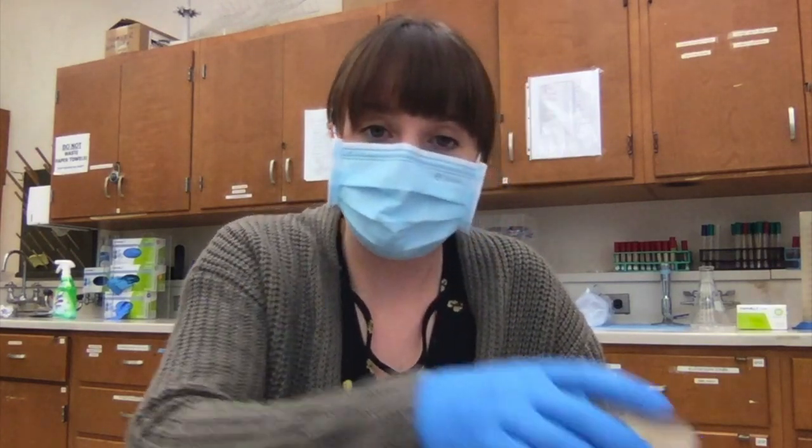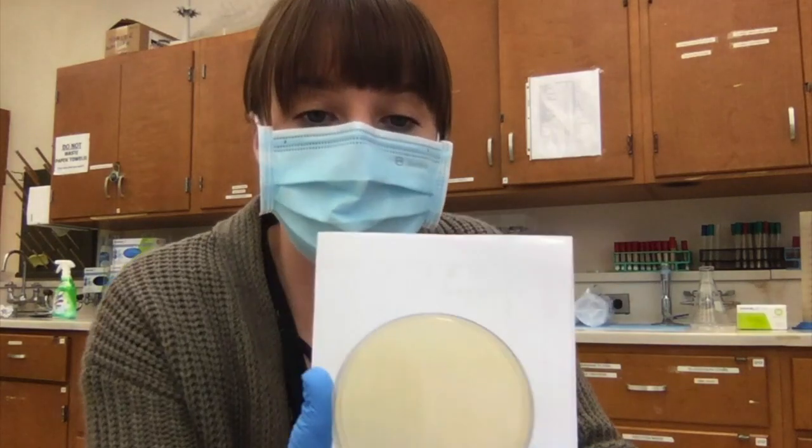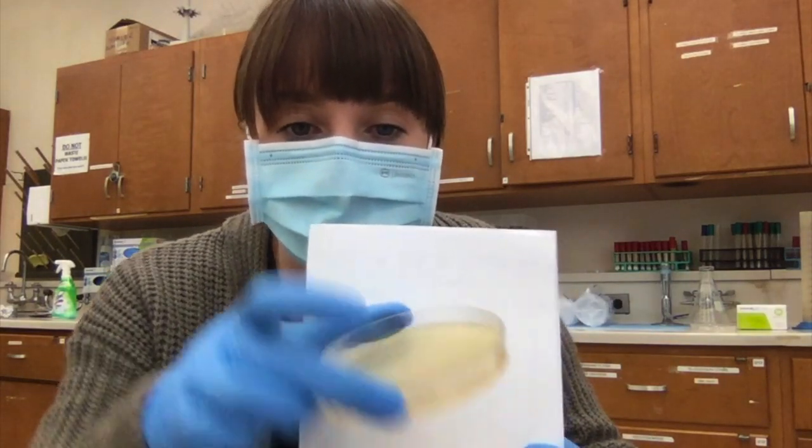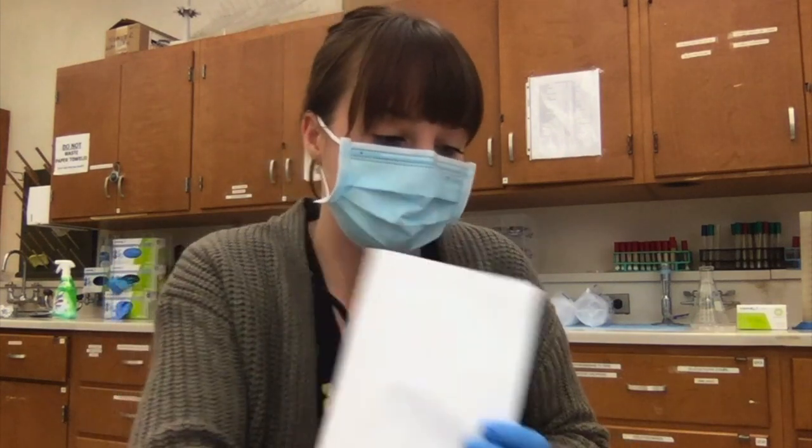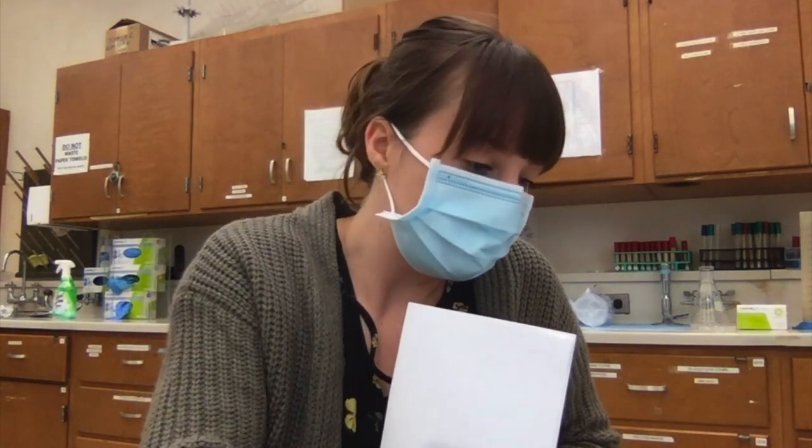The other thing that we made were plates. A typical plate is not going to have anything growing on it until you put it there, so we look for contamination after making them. I'm going to first show you a successful plate. Now you should only have these open around burners, but to show you, I'm going to show you a successful plate. There's nothing growing, it has just the right amount of media, and it looks good. So this is a normal nutrient agar plate.